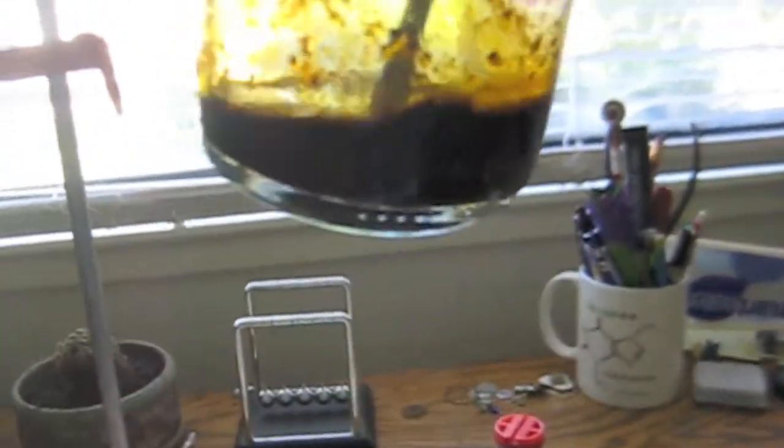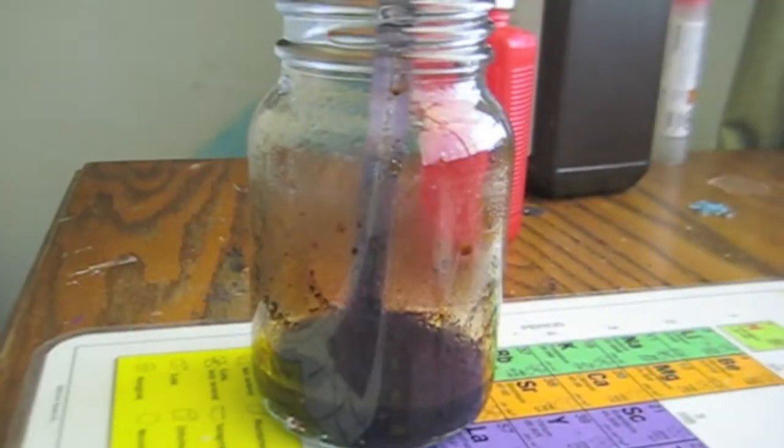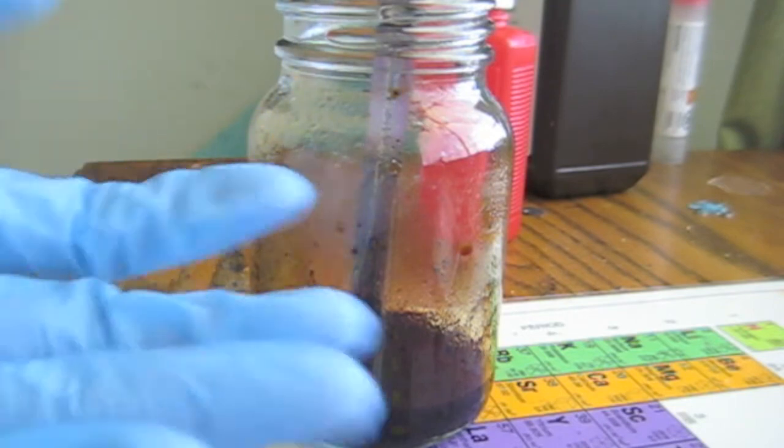So this comes from manganese dioxide and other compounds made when the potassium permanganate reacts with the sugar. This is manganates and other stuff because the sugar is broken down by potassium permanganate into carbon dioxide, which escaped through the jar, and a whole bunch of heat.